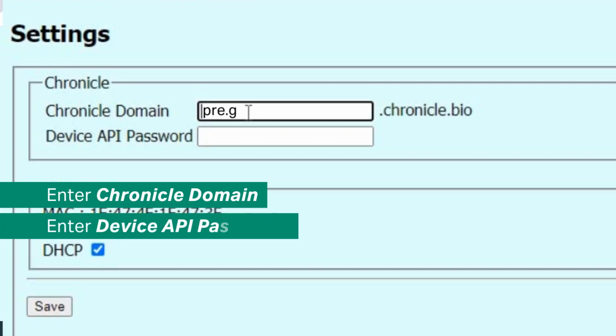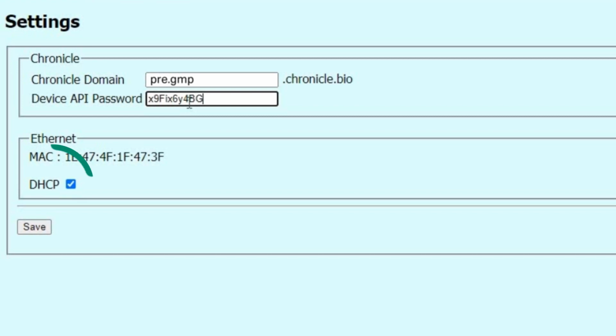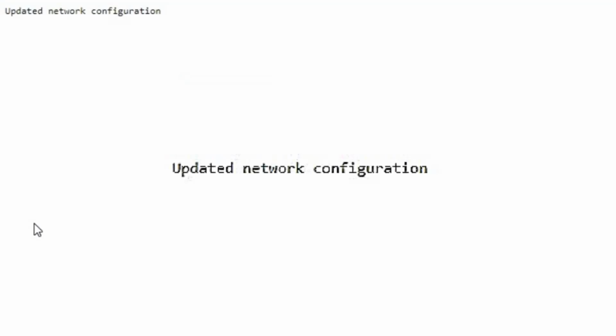Enter your Chronicle domain and the device API password in the designated fields. The device API password is found in Chronicle software on the Equipment Details page of the Thaw L1000 instrument, which was registered prior to the wired setup process. Ensure DHCP is checked and click Save. You will see an Updated Network Configuration confirmation message.